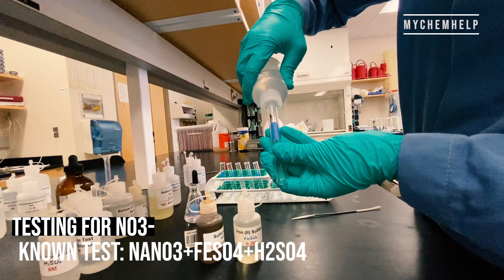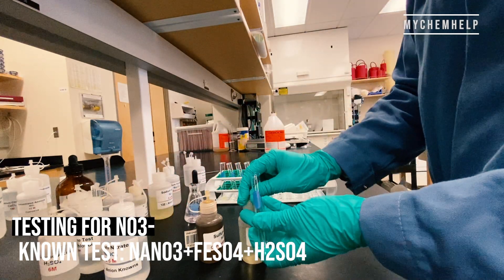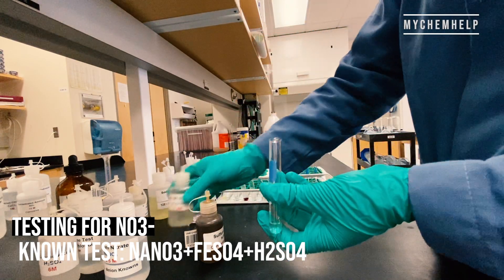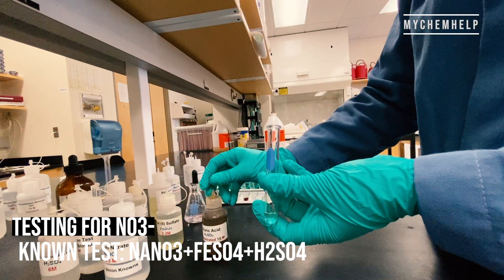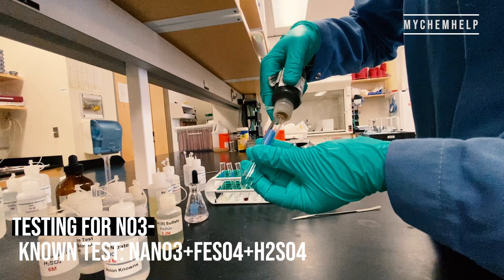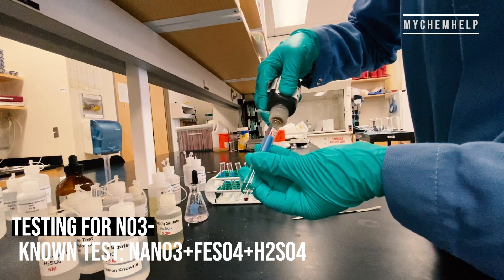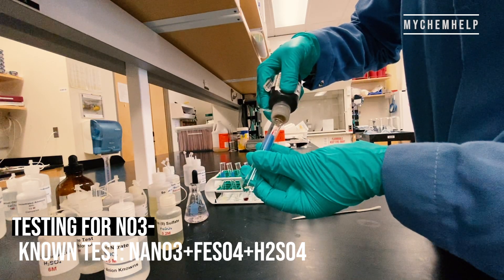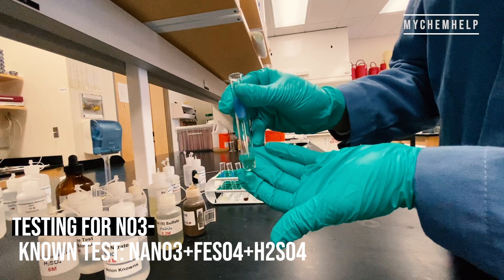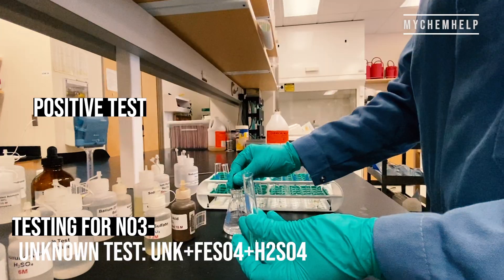Last one is the nitrate ion. We've got sodium nitrate and iron sulfate, followed by some sulfuric acid. Be advised to be really careful with the concentrated acids in this lab — they are very dangerous. I let it sit for just a minute to see if anything formed, and I noticed there was a brown ring. It's kind of hard to see, but there was a separation that meant there was a positive test.